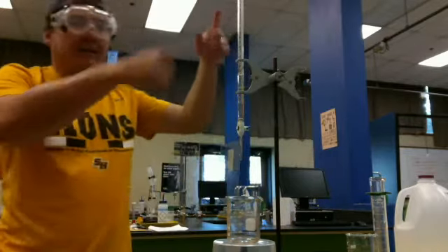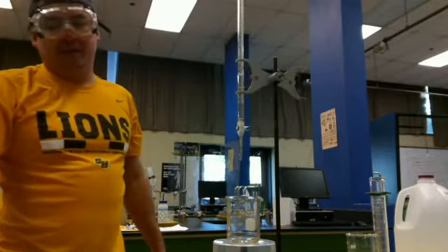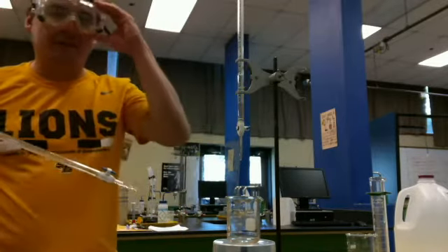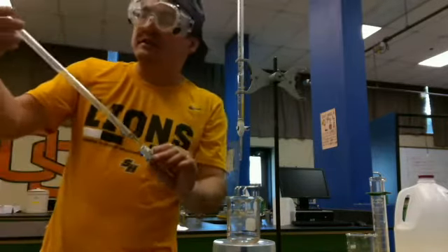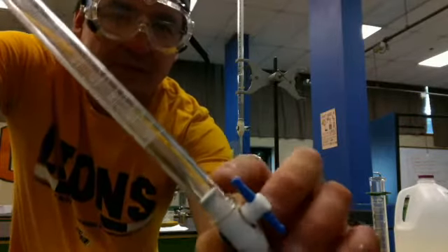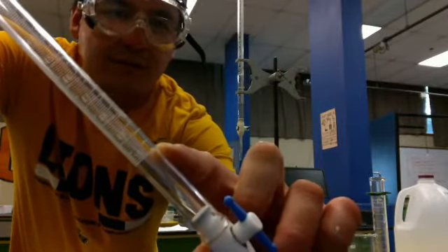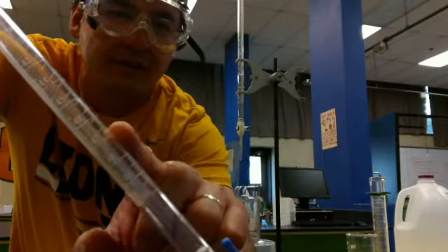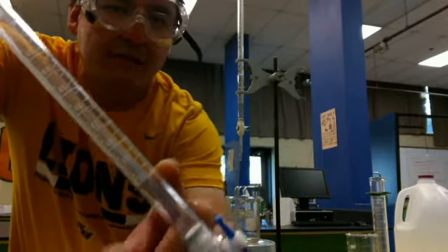So you'll notice standing right here, this is called a burette. It's basically a fancy test tube with a valve. It's also a graduated cylinder. It's graduated, if you guys can see on here. The numbers are very small. Those bottom numbers end at 50. Each one of these numbers is a milliliter. So that's 47 milliliters, 48, 49, 50.